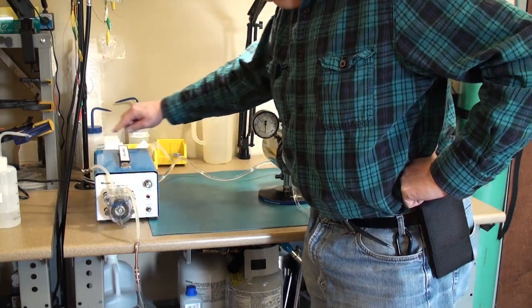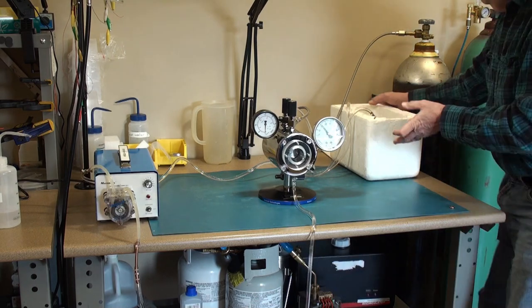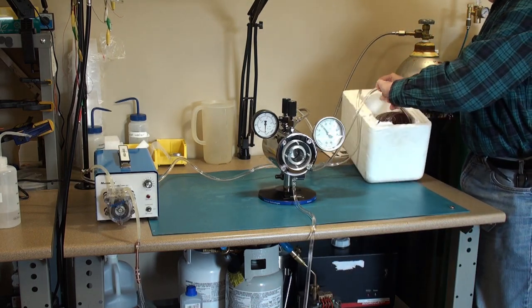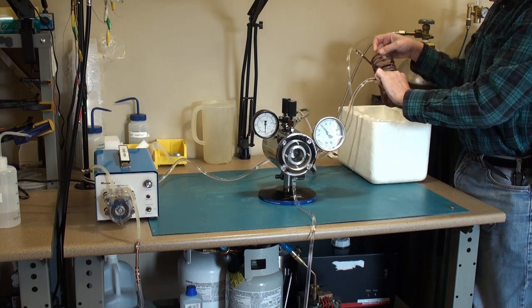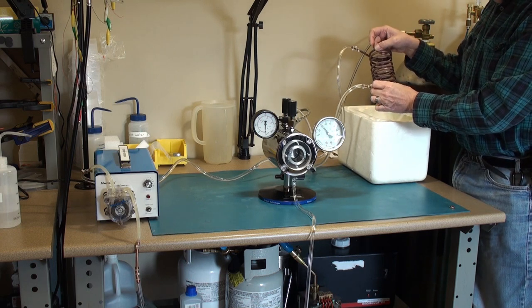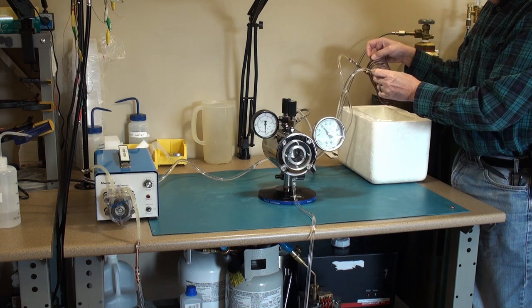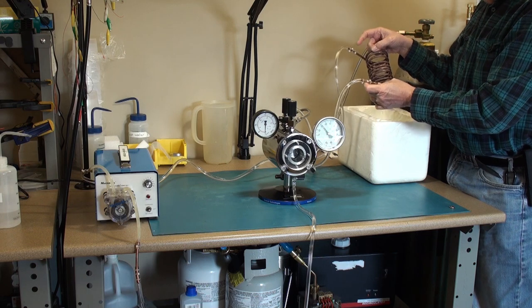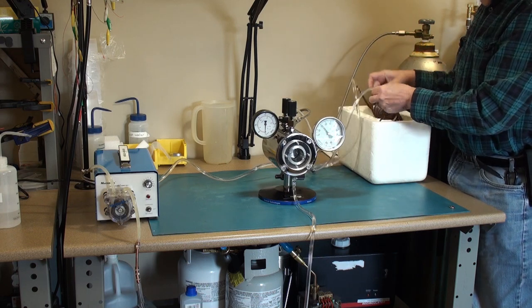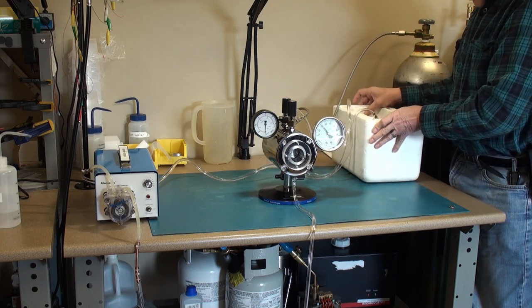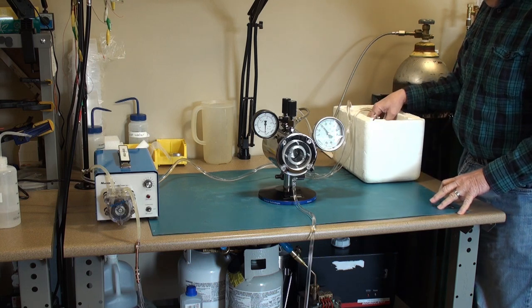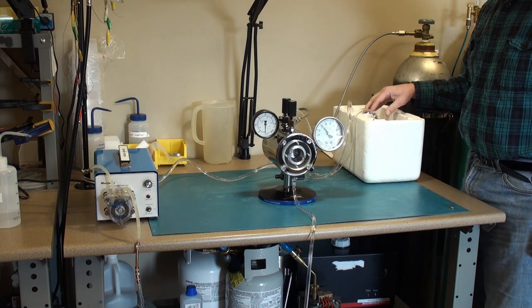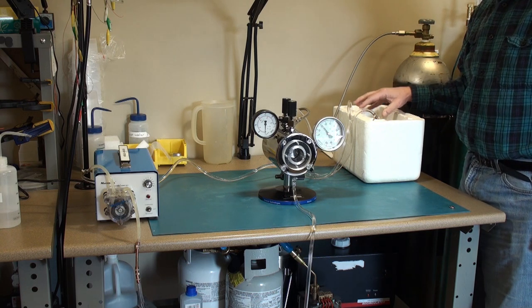I have the cooling or warming fluid circulation output going into the peristaltic pump. This is the output side. Around back here I have a styrofoam cooler with a piece of quarter inch or six millimeter refrigeration copper tubing to act as a heat exchanger. I just made a coil and I connected the in and out lines. In this styrofoam bucket I put a little bit of cold water to start. And what I'll do is I'll top it off with ice cubes.